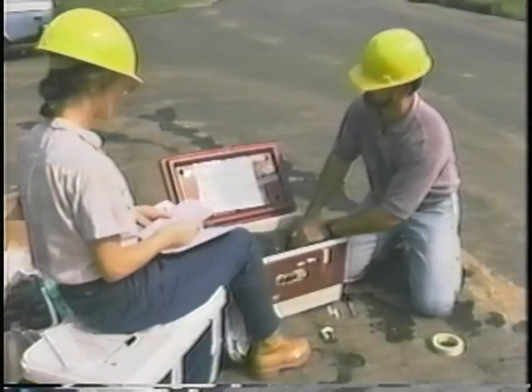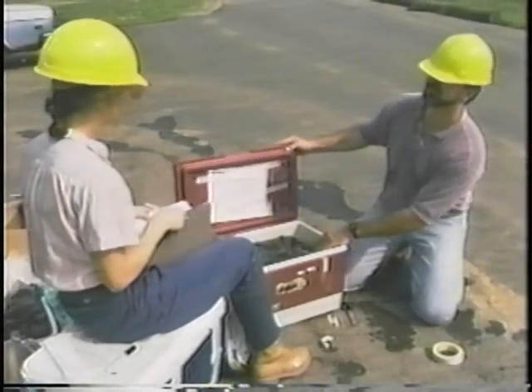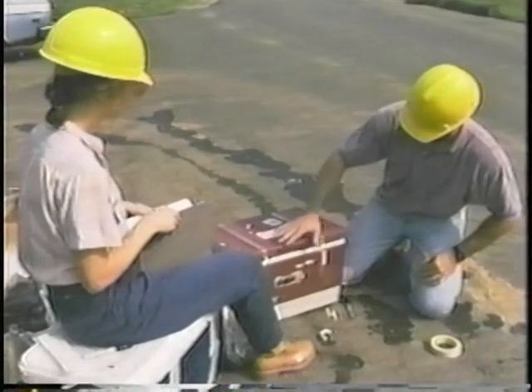Before sealing the cooler, make sure the chain of custody form has been properly completed. Once the samples have been sealed and packed, all that's left to do is ship or deliver the samples to the lab and clean the equipment one last time.